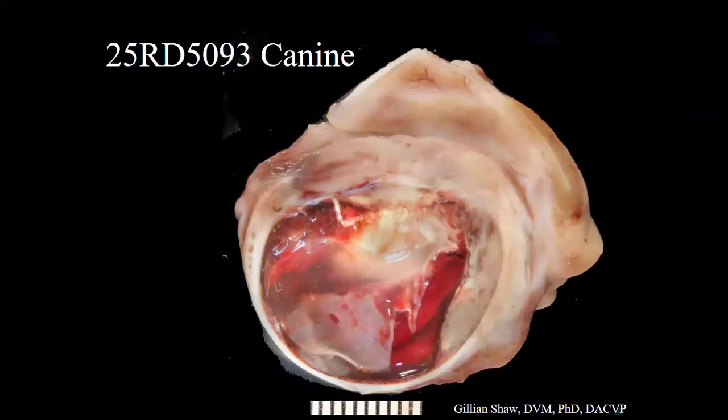So here is the globe hemisected. In this case, we did not actually remove the third eyelid. Since they had a suspicion of a mass, I think the person who was grossing this, who is a mystery, I can't remember who it was, was trying to preserve the surgical margins so that we could evaluate the surgical margins of this case. So we trimmed the lids off, but left the rest of the extraocular tissues attached.